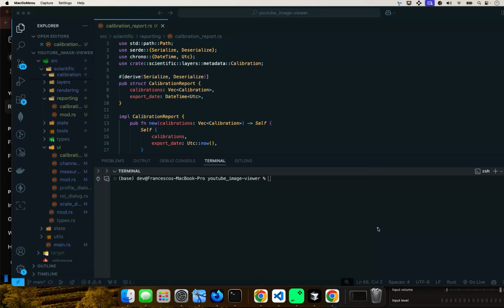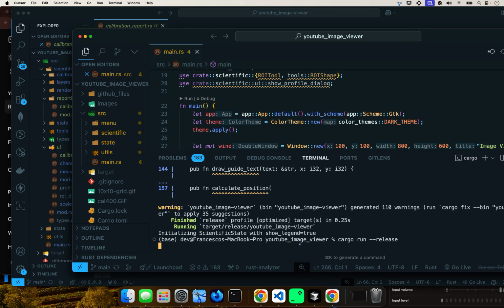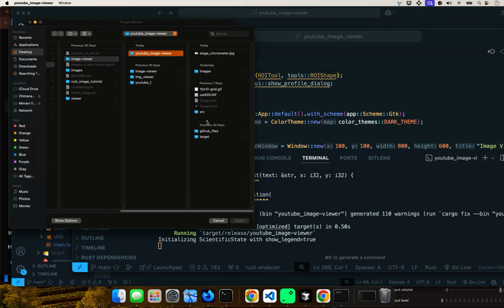Welcome to another tutorial. In this tutorial, we're going to continue where we left off in the last tutorial. If you remember, in the last tutorial, we were able to load the images and do the scale bar. Let me open an image first. This is what we did in the last tutorial.